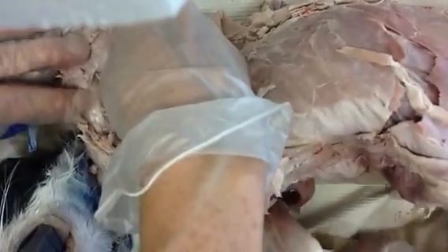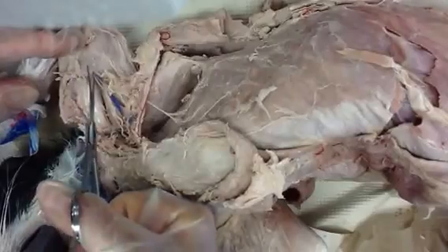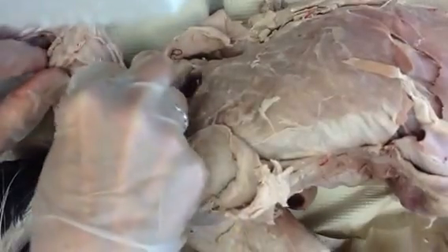I like these little pointy scissors that get into small spaces without making too much damage. Now I can separate — look how nicely that goes down into that limb, into the brachium. We'll snip some more open and see if we can get to the point where they begin to separate into the various regions of the lower limb.